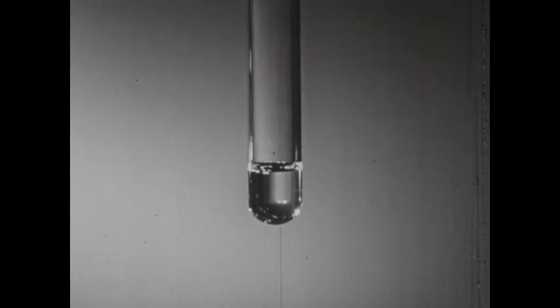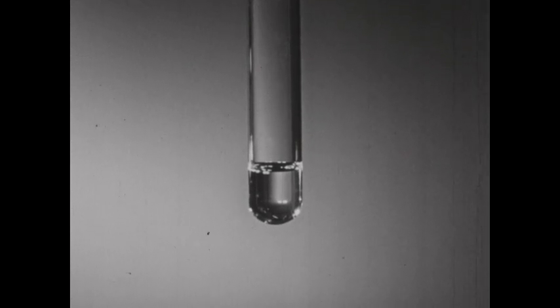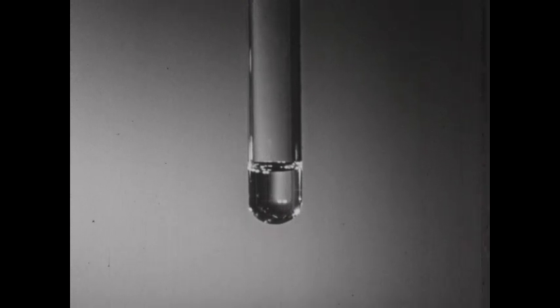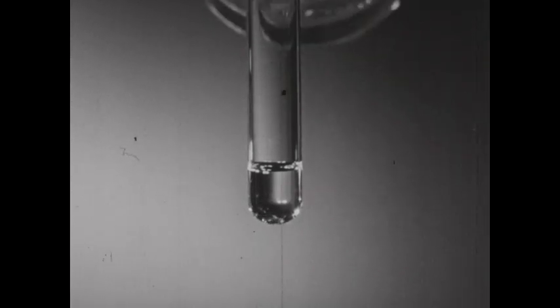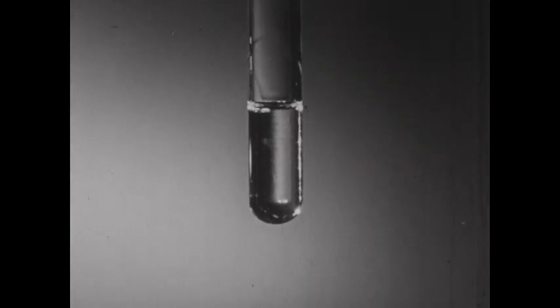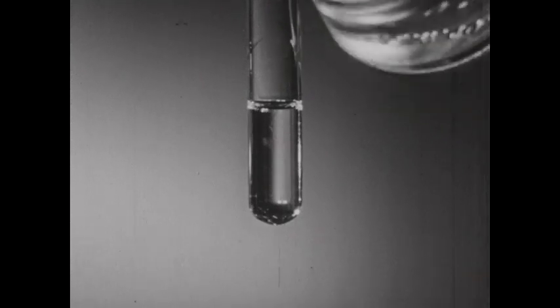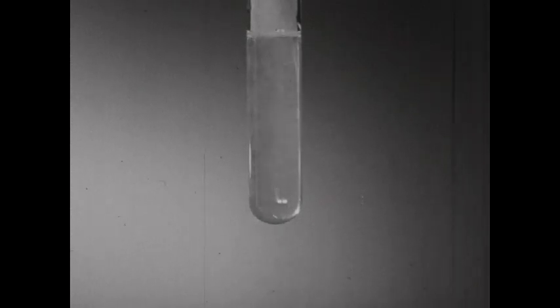A common test for the phosphate ion involves its reaction with solutions of ammonium molybdate in the presence of nitric acid. To a few milliliters of sodium phosphate solution, a small quantity of ammonium molybdate solution is added, and then the mixture is made acid with nitric acid. The yellow precipitate which forms is ammonium phosphomolybdate, and its characteristic yellow color serves as a good test for the presence of the phosphate ion.